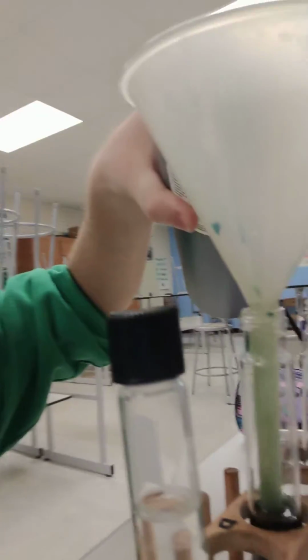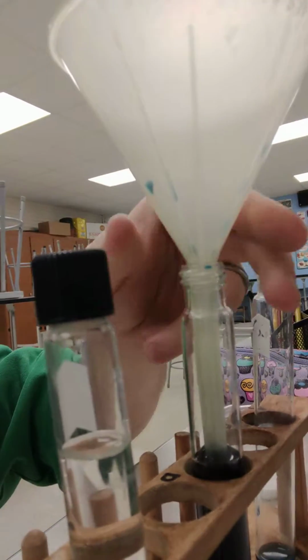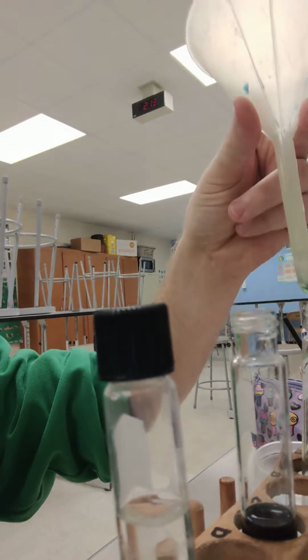So what I'm doing is just pouring some of this BTB, this bromothymol blue, into that test tube that had some leaves in it. I'm going to leave it open so that the gases are going to be able to be exchanged, but it's going to start out as kind of blue here because that's just the normal color that it's going to start with. If carbon dioxide is present, it's going to start changing into a green, possibly yellow color, depending on how much is actually there. Now we're going to have two setups for this.